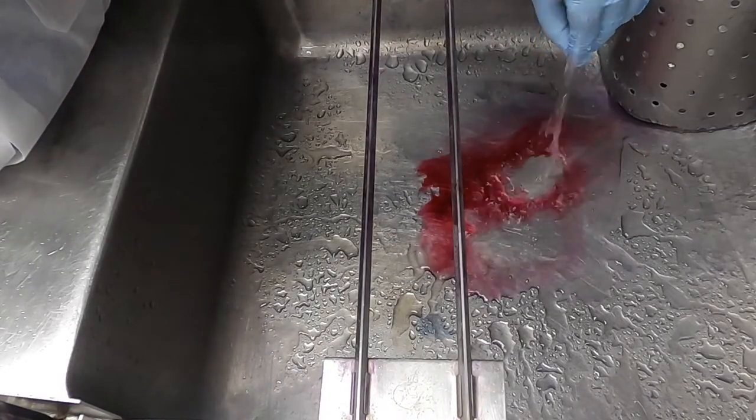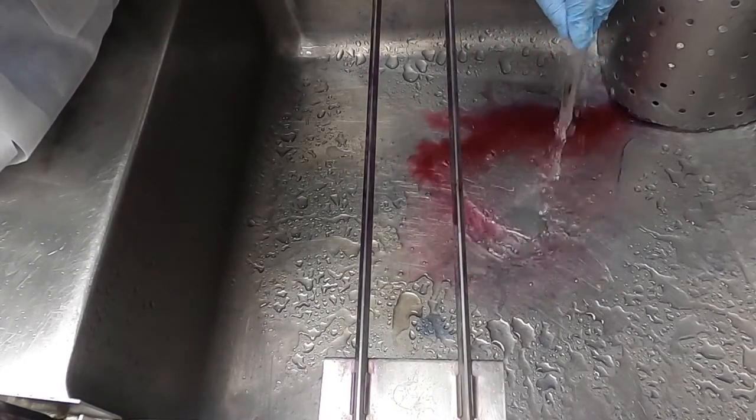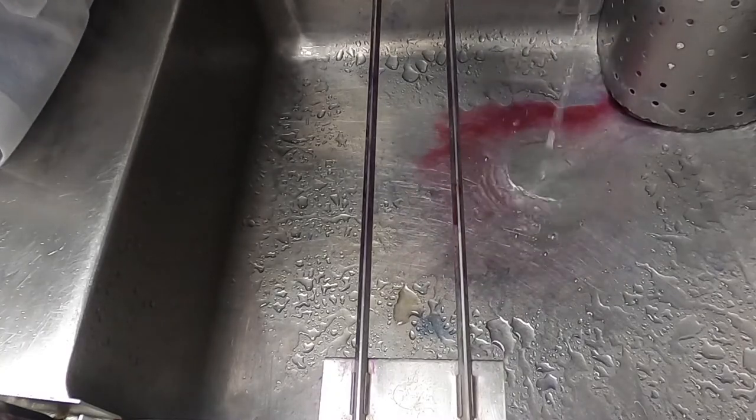Once this is done, once the slide is rinsed, you can blot it dry and you're ready to visualize your specimen under the microscope.